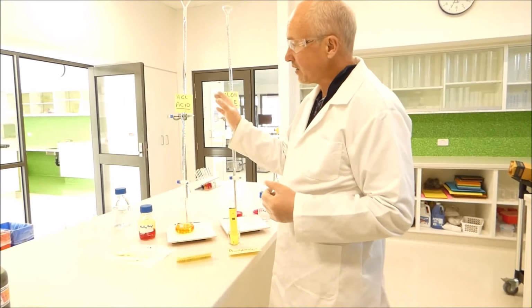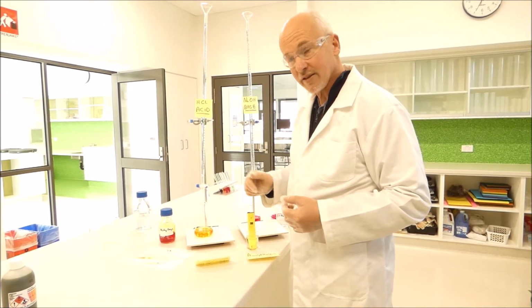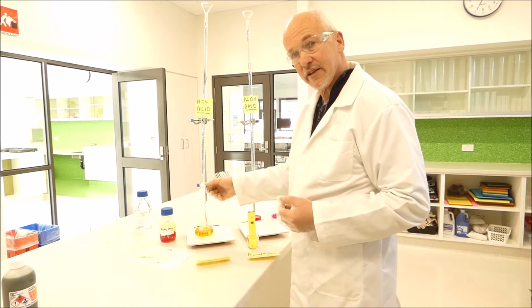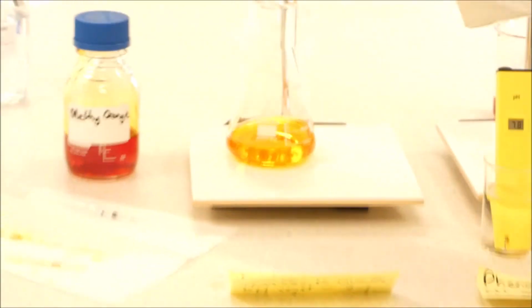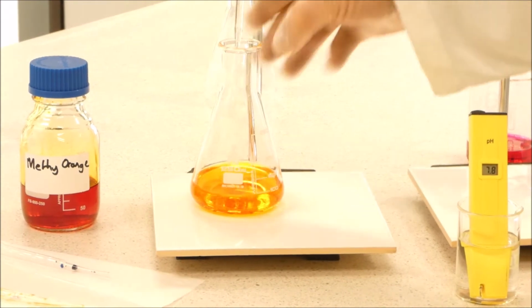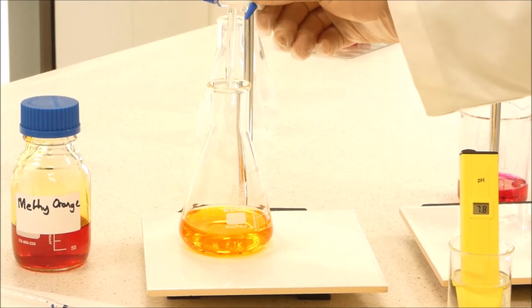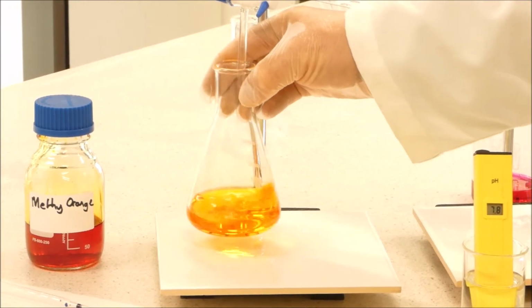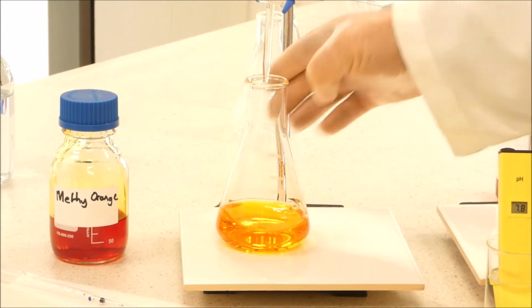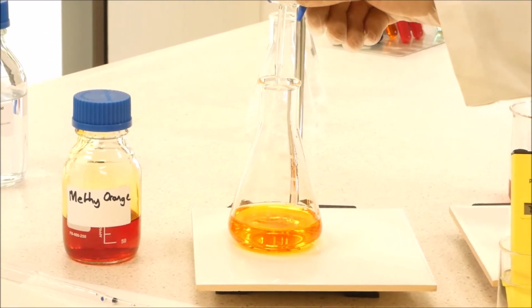We're going to test the methyl orange by adding hydrochloric acid very slowly using our burette, and very carefully, if we zoom down onto the conical flask now, we'll add small amounts of hydrochloric acid, and you'll notice again, as we do that, you get a little bit of red forming in the solution, which shows that the indicator is changing when the acid first hits the indicator.